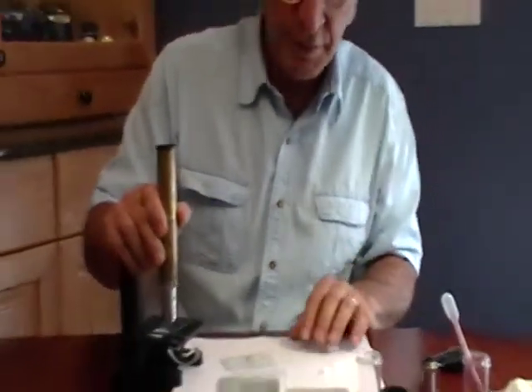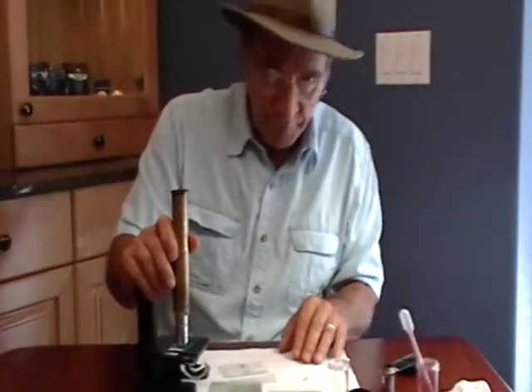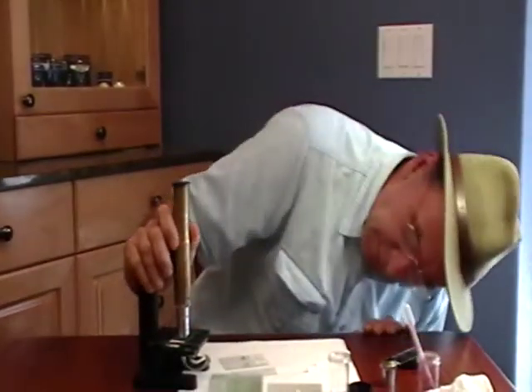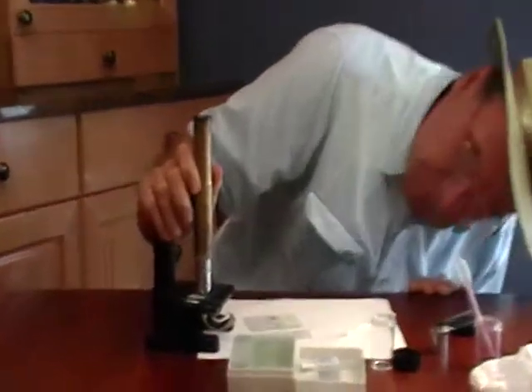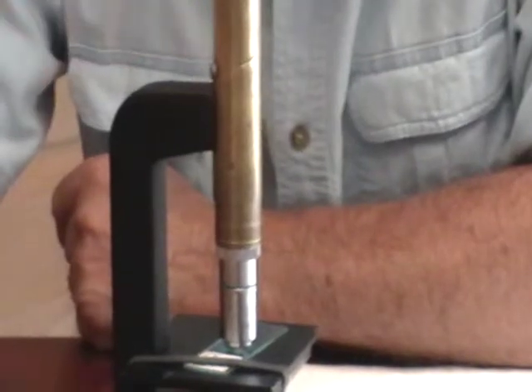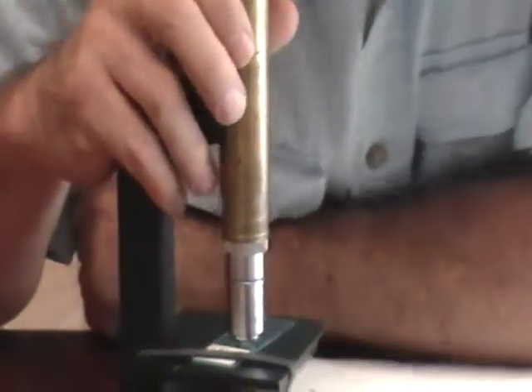When this is in focus, it's right on top of that cover glass. This is the prepared slide. If I start all the way down, almost touching, using the ramp here — this is the model 70 ramp that I added after I originally created the 60. This was to give it the fine focusing ability without even adding another part. So you use that ramp.